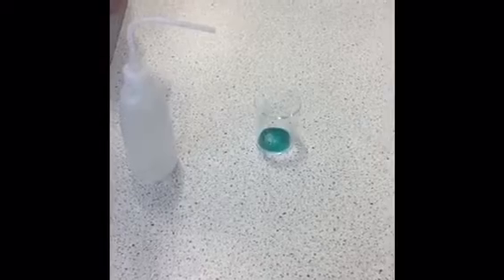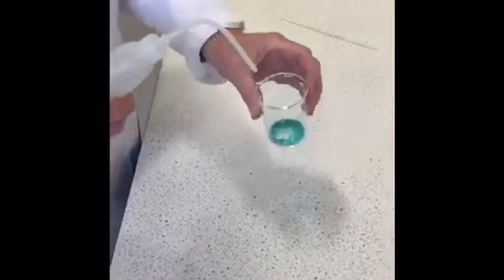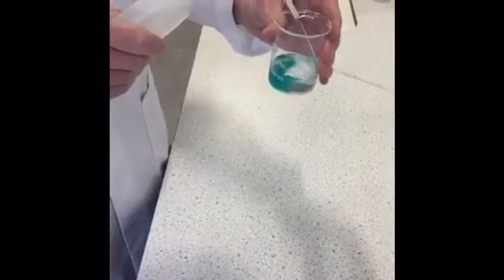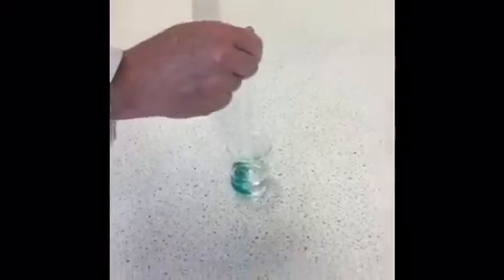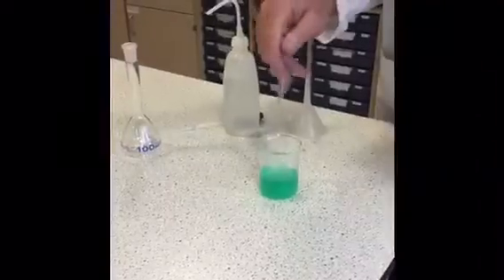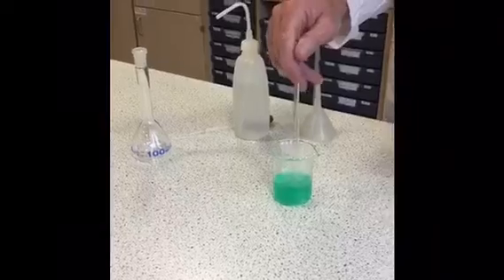So the next thing we have to do is to dissolve the nickel salt in approximately 25 cubic centimetres of distilled water. Now, we're just going to use the markings on the sides of the beaker to judge the 25 cubic centimetres. Then once it's fully dissolved, we'll transfer it to a 100 cubic centimetre standard flask. Okay, so that's all the nickel salt completely dissolved.